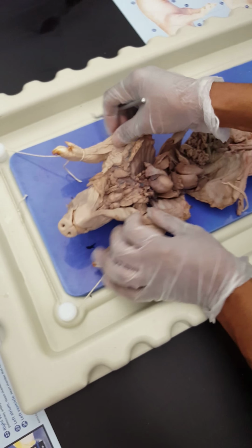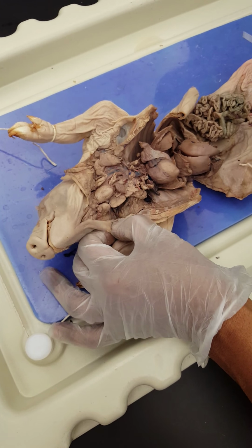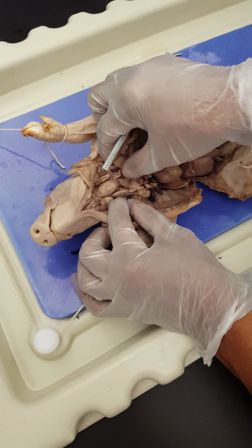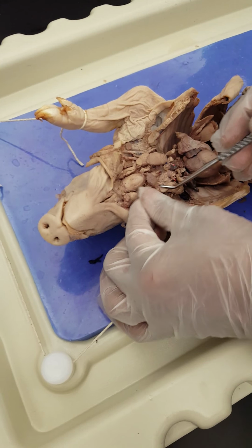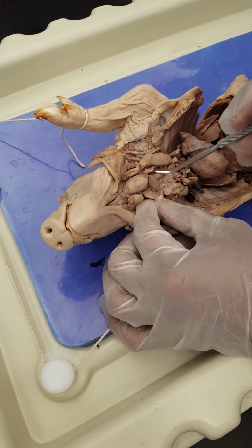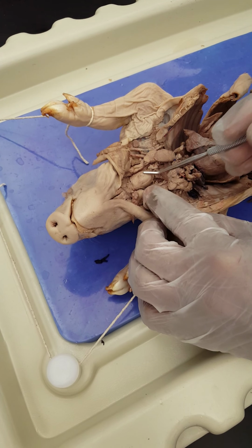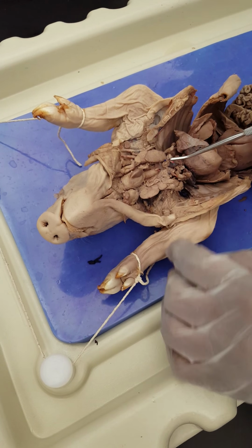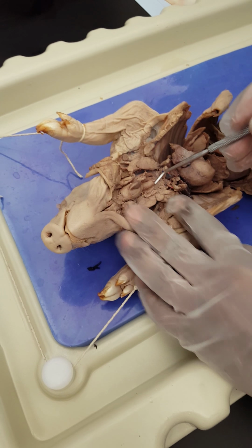So, this is a fetal pig. First of all, we're gonna start from the top. Here you got the thymus. This is the second side of it. It's a gland that, of course, is bigger, and that's why you see it in the fetus, big like that. This is the larynx. The trachea was on top of it here. We kind of shaved it and tilted back a little bit to expose the larynx. So this is the thyroid gland, okay? This brown thing here is the thyroid. This is the larynx. You go down here is the trachea. Because of the trachea rings, you can see the rings, right?